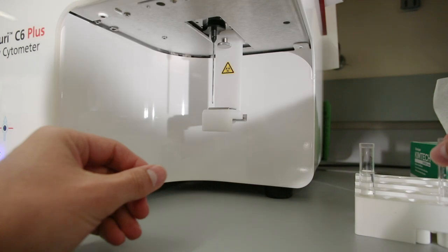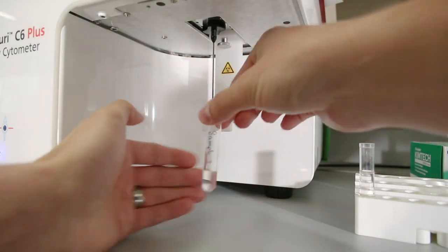If backwashing occurs, use a sample of media between your samples to reduce contamination.